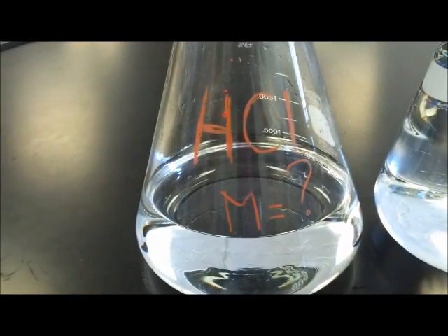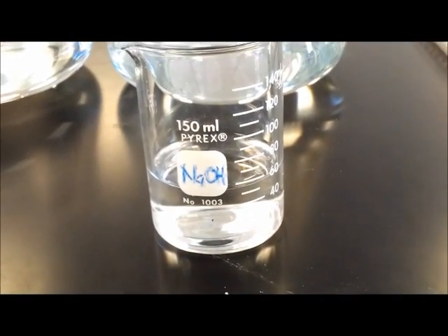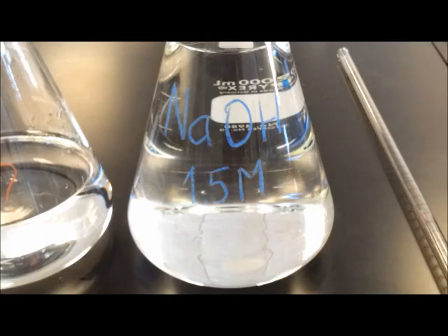For the lab we need an acid, in this case of an unknown solution, and a base, in this case of a known solution, 1.5 molar.